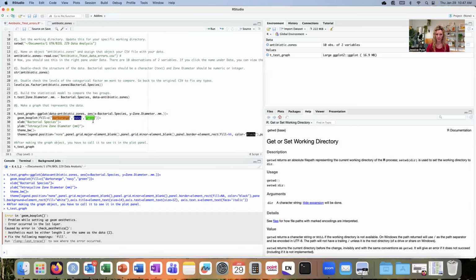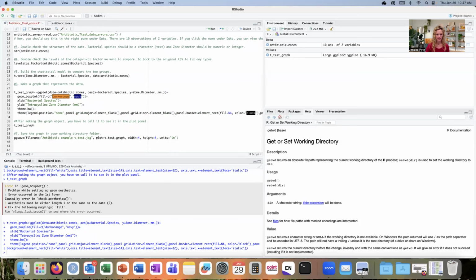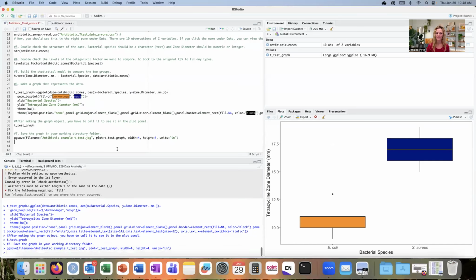The problem is that we have 3 different colors here. We need to delete that last color because we only have 2. We have 3 colors listed, but there's only 2 boxes that need to be plotted. So I'll go back and delete that color and try to run this line again. Okay, that ran correctly without error. I'm going to create this graph, and now I have a functional graph. And everything within this looks exactly like it should. I can now save this file and copy it, paste it, or insert it into the worksheet and submit that along with the rest of my assignment.